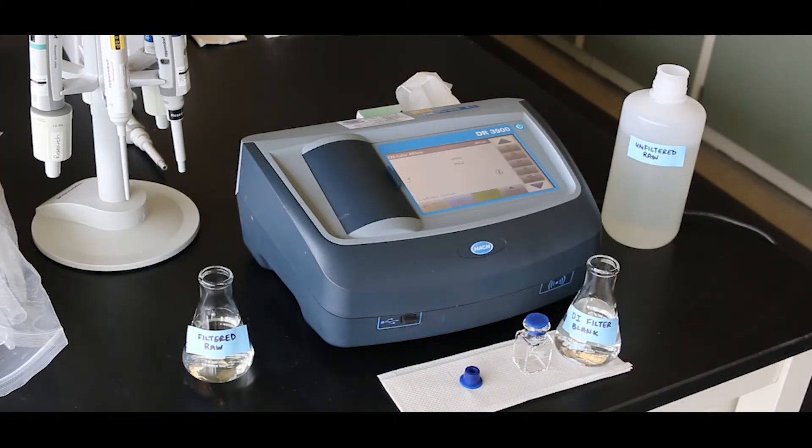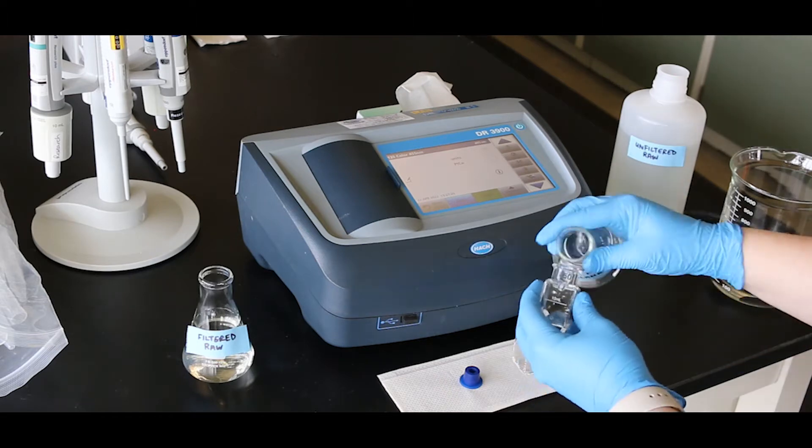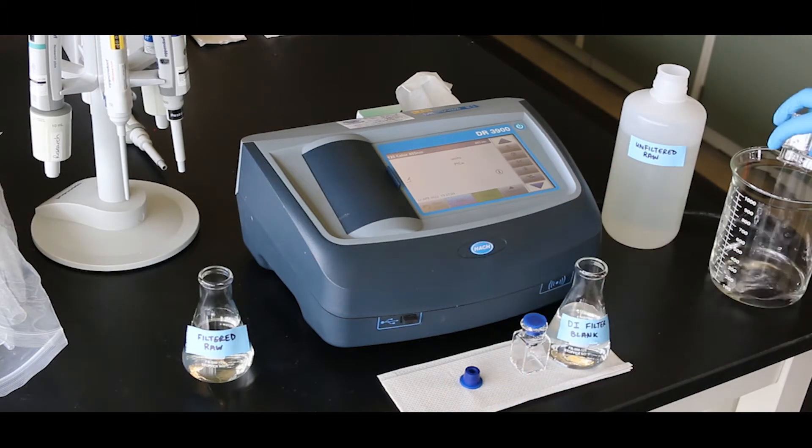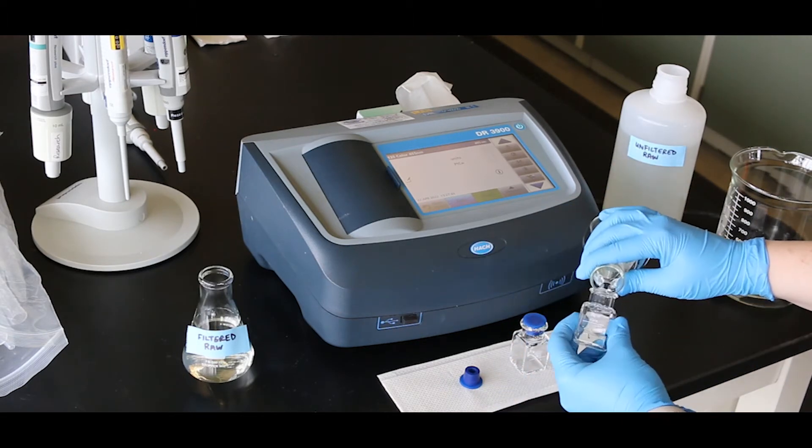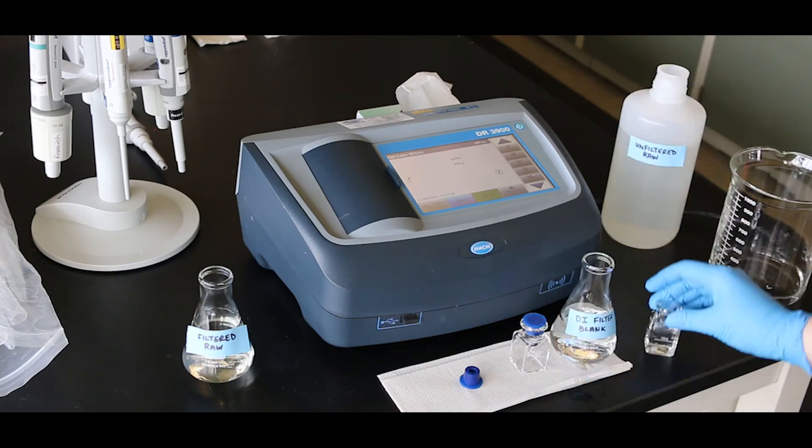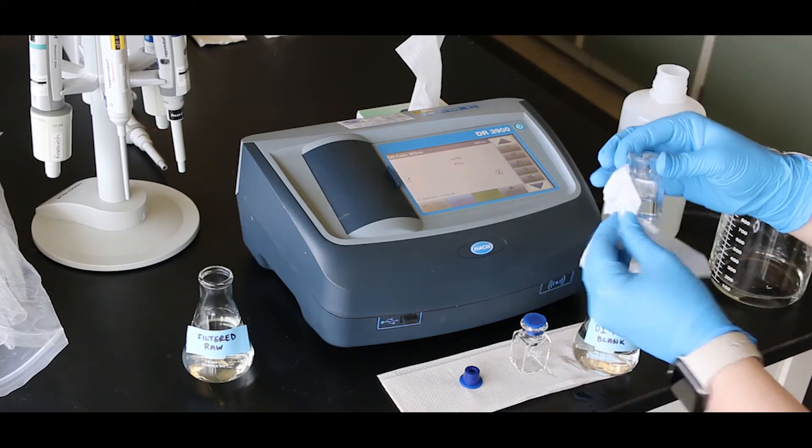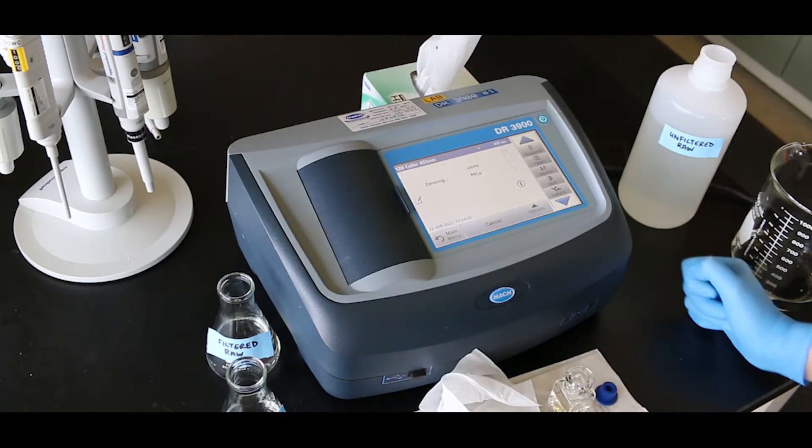Prepare the blank. Rinse and fill the blank cell with deionized water. Make sure to clean the outside of the cell before placing it in the instrument. Press zero on the instrument.